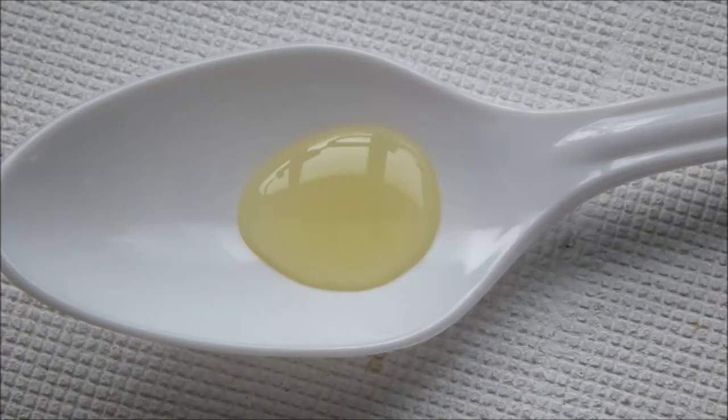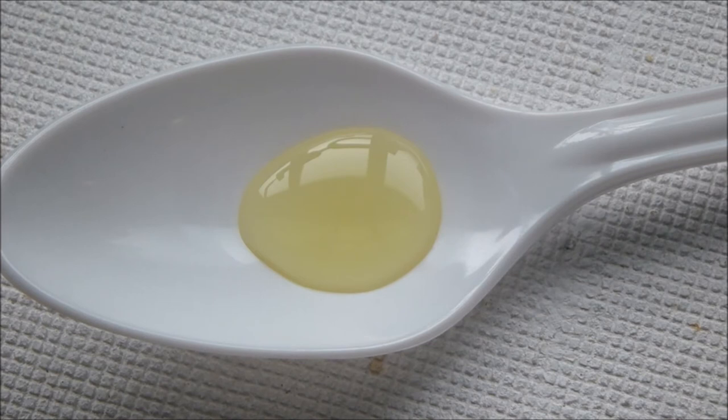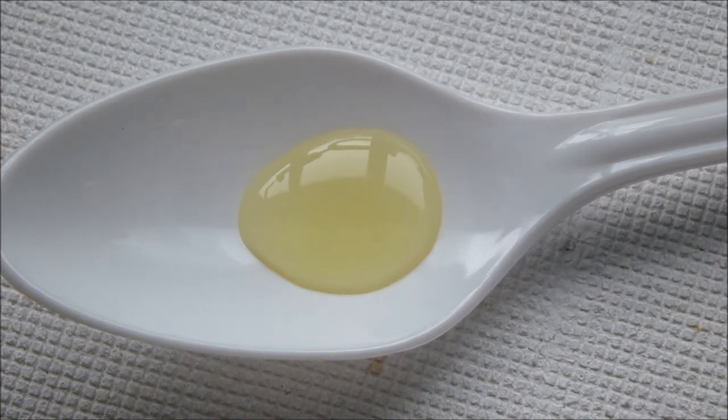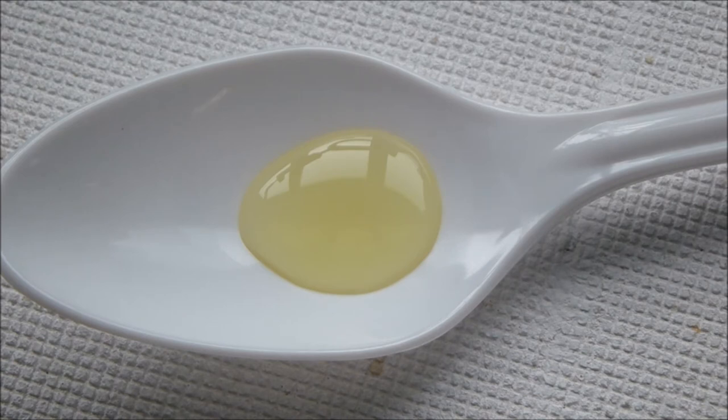Okay guys, so I've got a fair bit of that solution that we've just dissolved the gold leaf in and transferred to a nice white spoon here. Now we'll give it a few drops of stannous chloride.